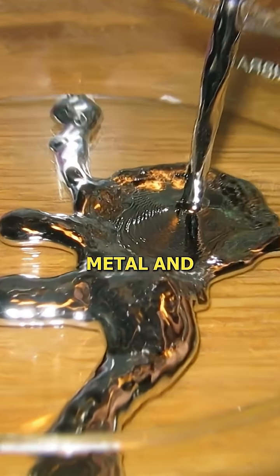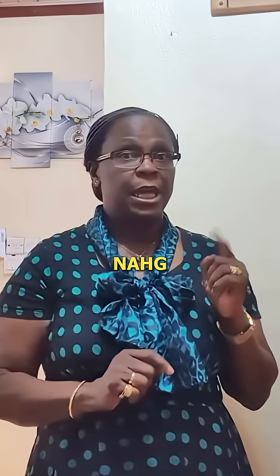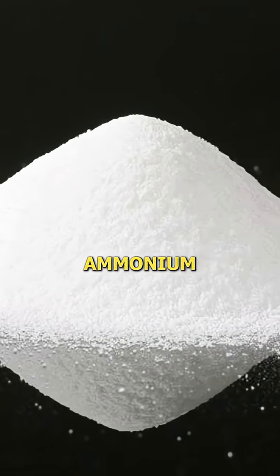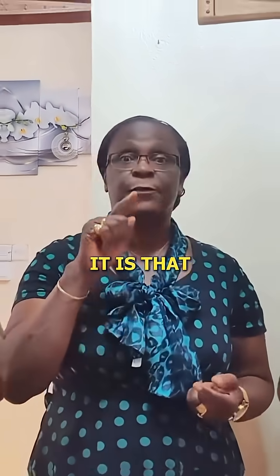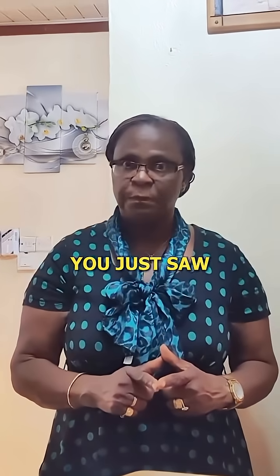This is a reaction between sodium and mercury. Mercury is the only liquid metal, and this reaction produces sodium amalgam, which is NaHg. When sodium amalgam is reacted with cold concentrated ammonium chloride, you produce ammonium amalgam, which is unstable — that fluffy gray substance you just saw.